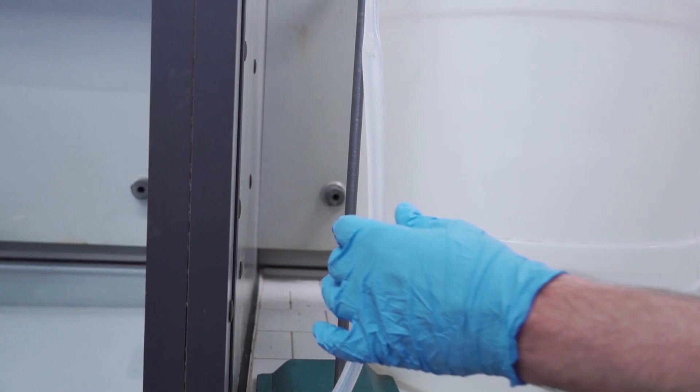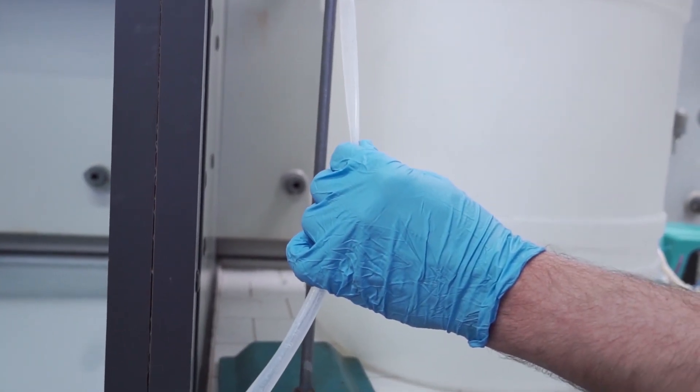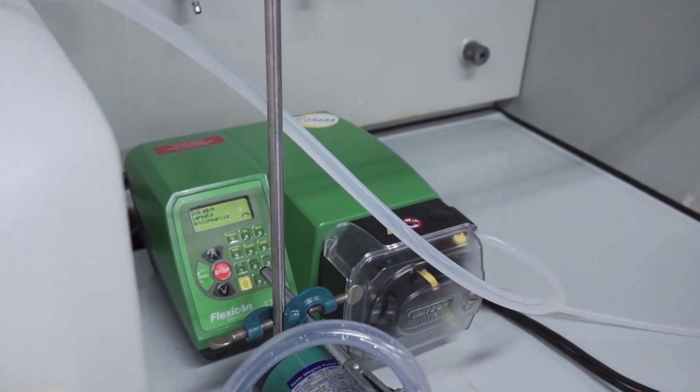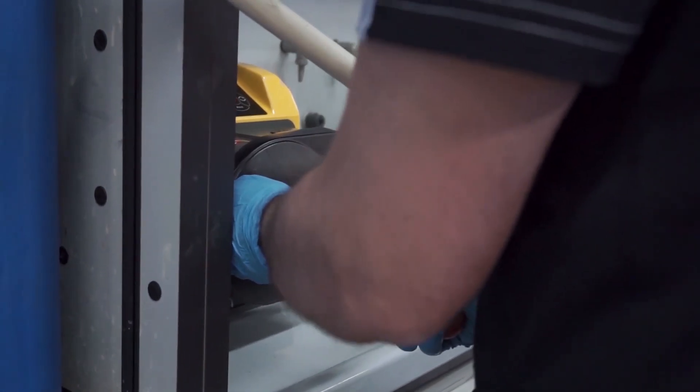In the event of a malfunction during the operation of the system, such as a sudden rupture of a tube or a connection, it is suggested to stop the operation immediately. Empty the liquid still present in the tubes, open the pumped tube housing and replace the tube as shown.